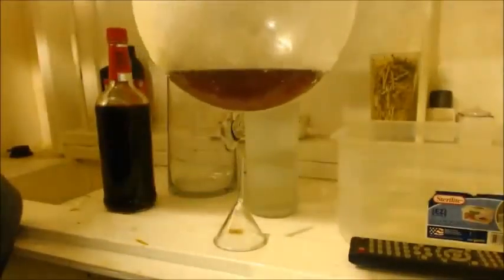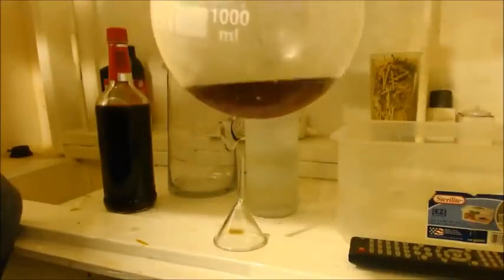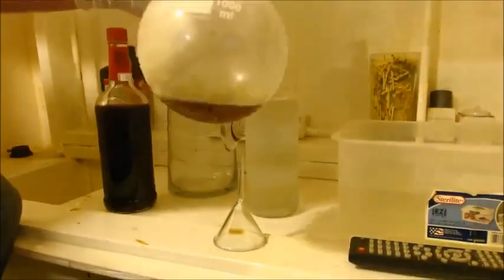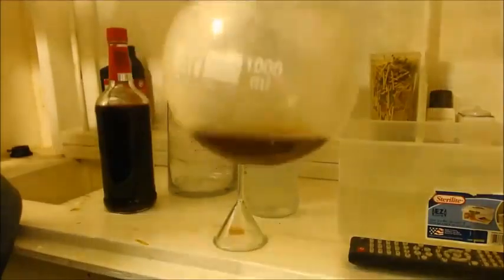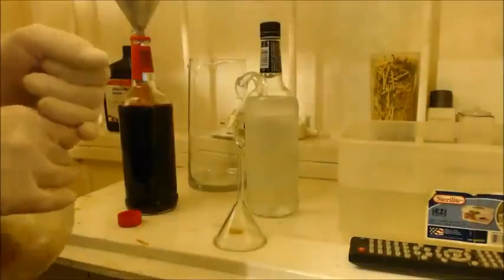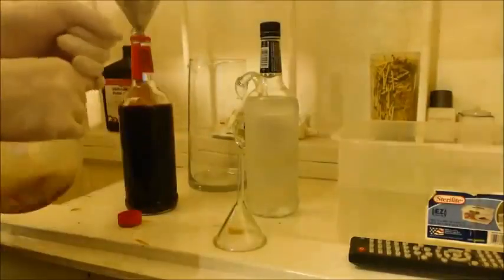This is the styrene. It wasn't that dark when I first did it. It's been sitting there for a couple days. It's polymerized even more than it was. Half of it, though, was already polymerized. All right, so I just want to get rid of this crap.